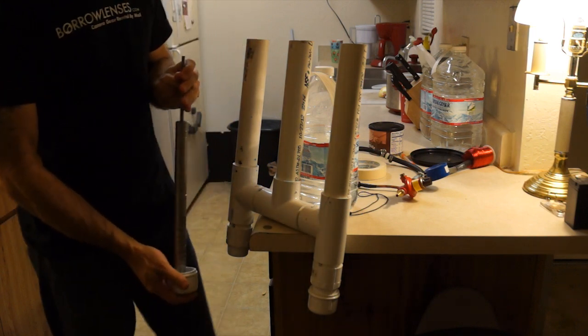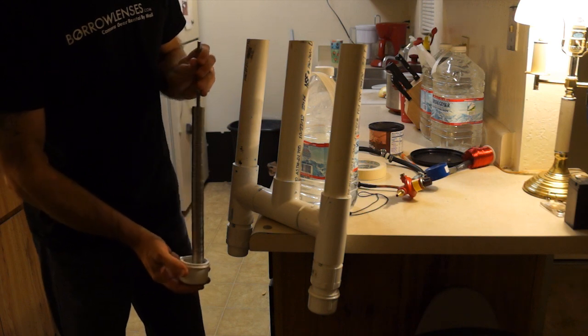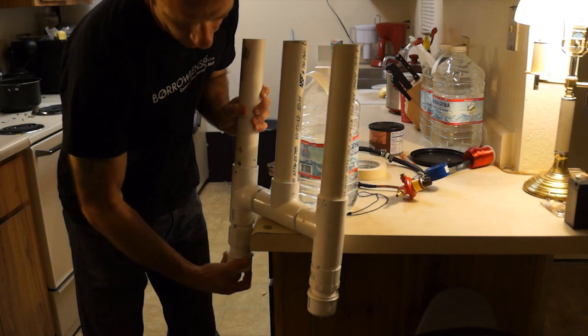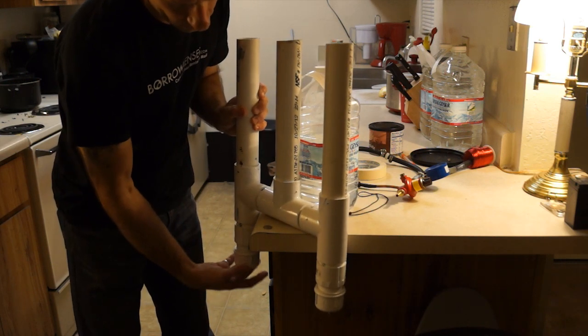Now I'm only expecting about a liter a minute, maybe. I'm going to use NaOH as my catalyst just to start with so that I can make sure that it works.